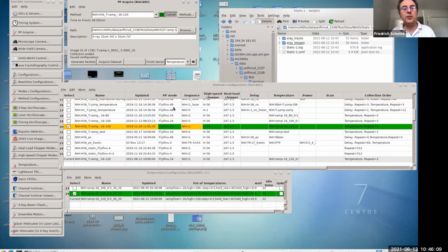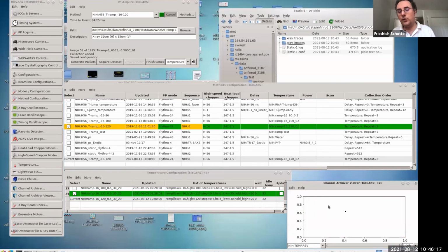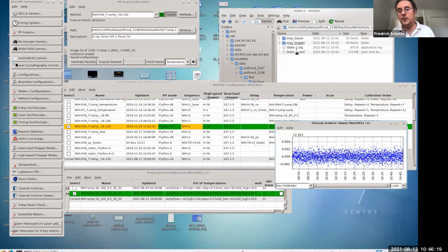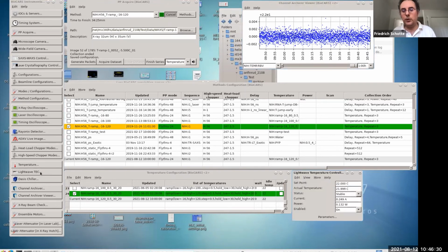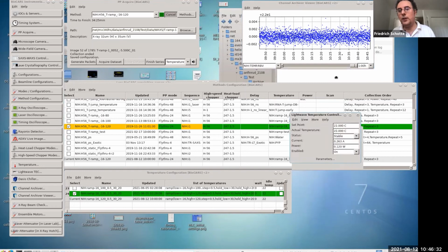It's also nice to monitor the progress of this. We have a temperature chart that records the actual temperature. Of course, we don't have the actual controller; this is just a simulation. Here is the temperature controller control panel. You can monitor the set point, set to 22 right now.